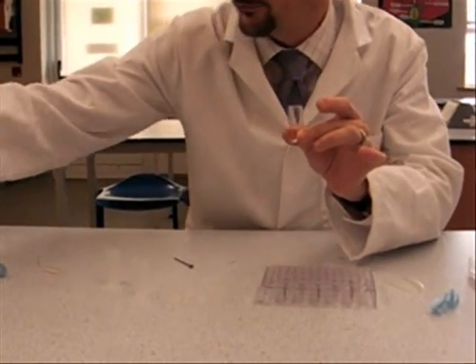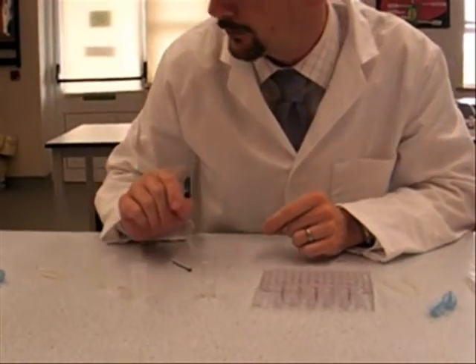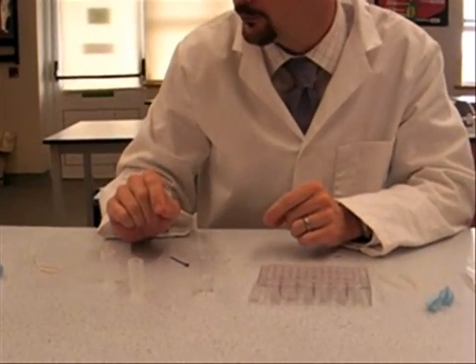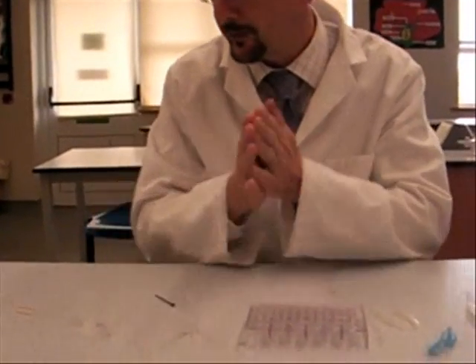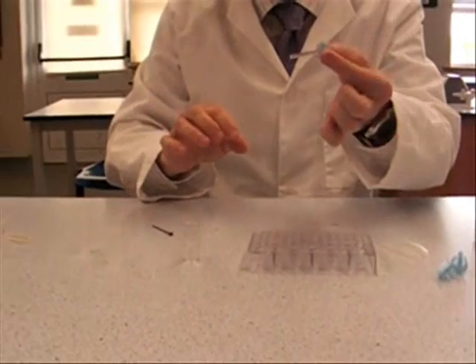Put your meths on the side, in fact right on the side of the lab because you do not want that exposed meth anywhere near a naked flame. Then get hold of the top of the spirit burner.